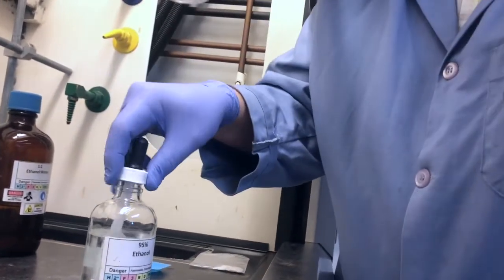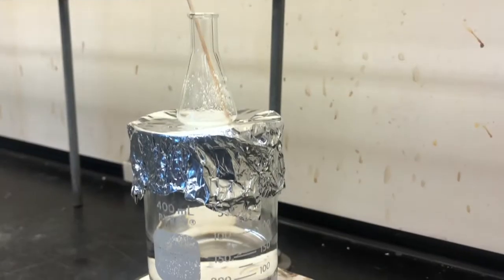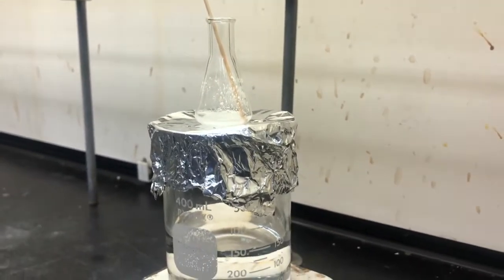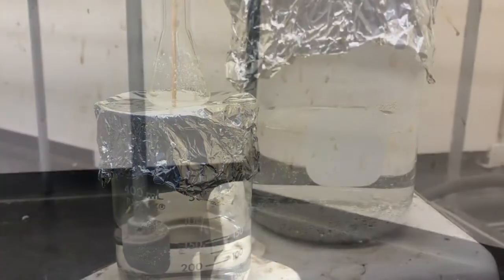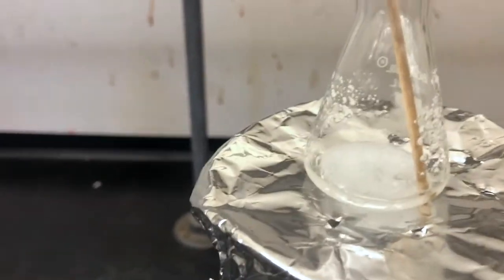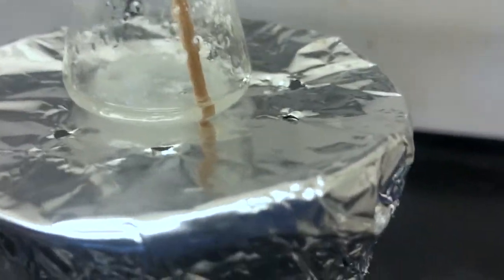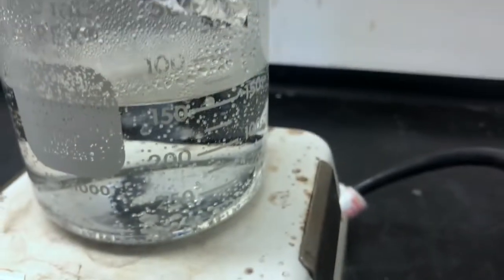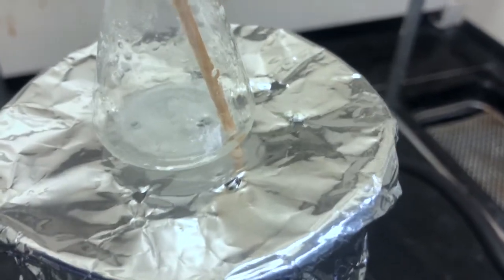So the technique is you add enough solvent to just barely cover the solid, just start to dissolve it at room temperature, and then you heat it up to its boiling point with a wood boiling stick to try and finish the dissolving process. This takes a lot of patience, just the right temperature. If the water is boiling too rapidly, you can overboil the recrystallizing solvent. Here you can see there was still quite a bit of solid stuck on the side, and there was still some solid in the solution at the bottom. We didn't have a terribly hot steam bath at this point.